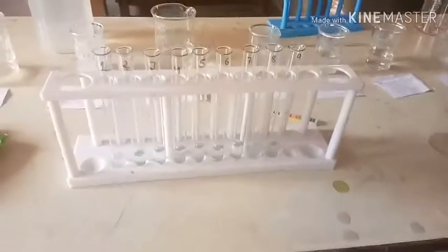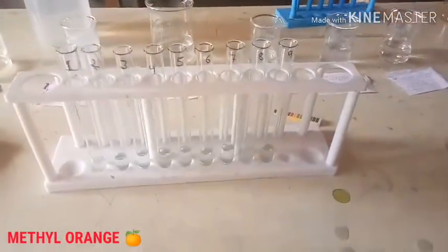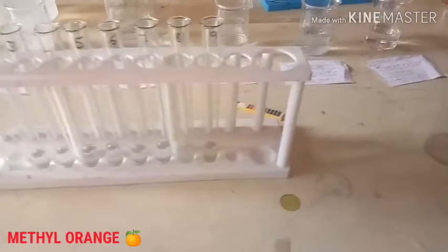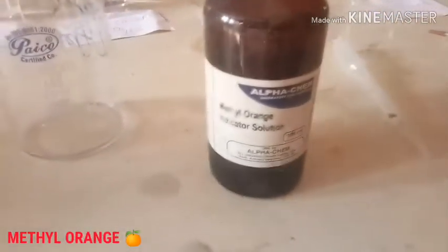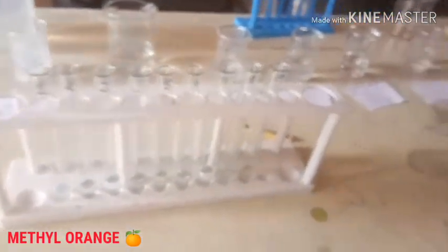We have arranged all our 9 samples in the same sequential manner as we have done. The fourth indicator we are going to use is Methyl Orange to see its impact on acids and bases by observing its color.